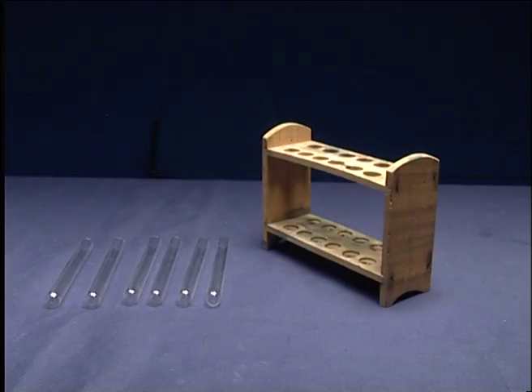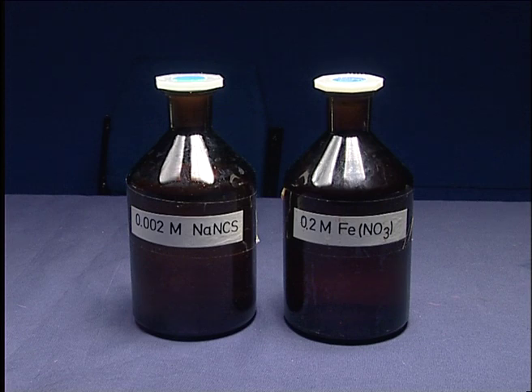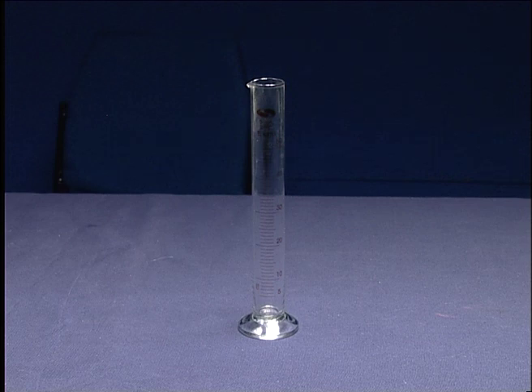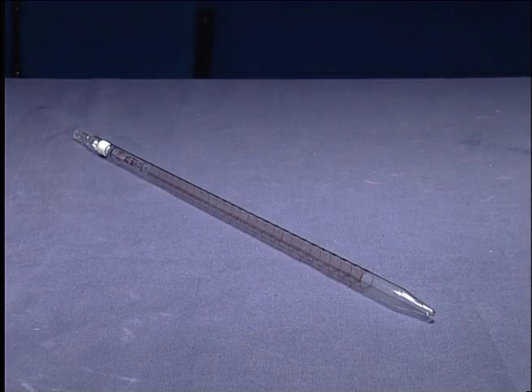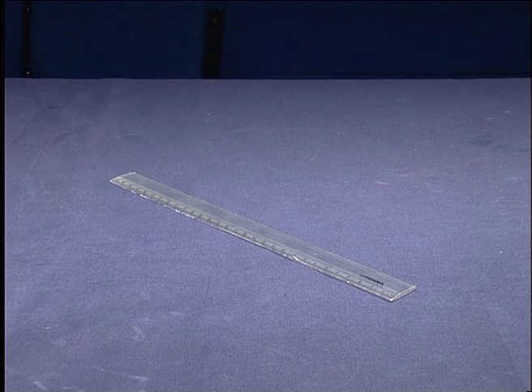Test Tube, Sodium Thiocyanate, Ferric Nitrate, Graduated Cylinder, Pipette, Ruler.